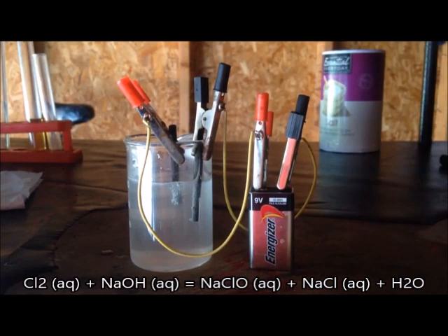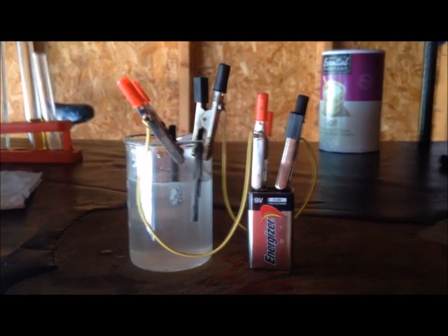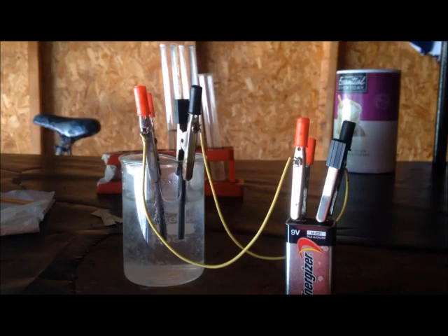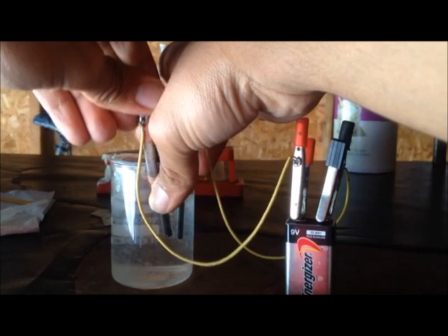I want a low temperature, much below 60 degrees Celsius, to prevent the formation of sodium chlorate from sodium hypochlorite. It looks like a significant amount of reaction has occurred and we should have some bleach in here, so I'll stop the reaction now.